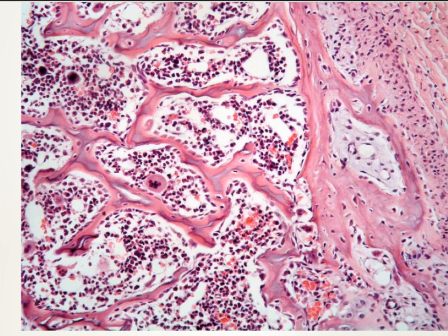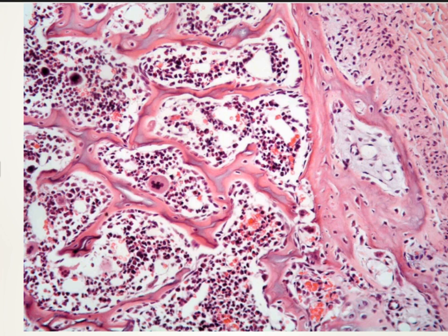This is also a picture of the spongy bone, and you can see here the multiple bone marrow cavities, and you can diagnose also a very nice cell here inside the bone marrow, which is the megakaryocyte, formed of a multi-lobed nucleus and of big size.